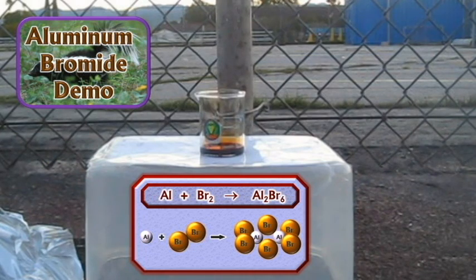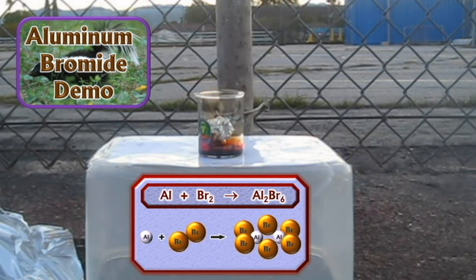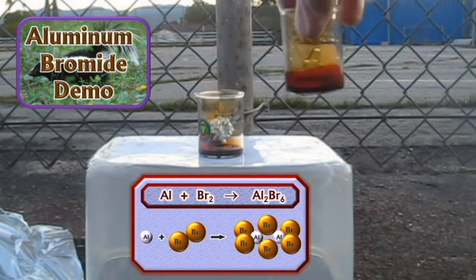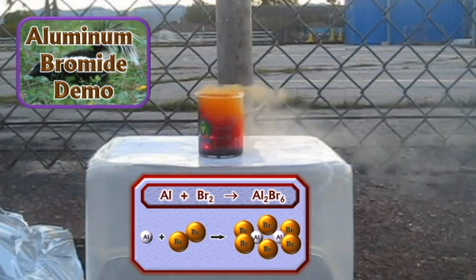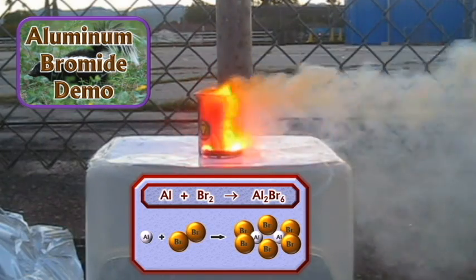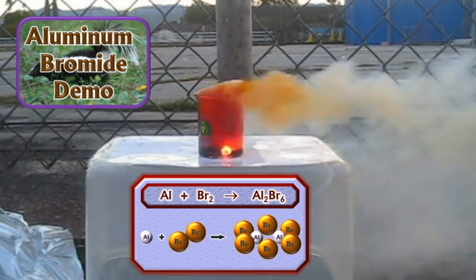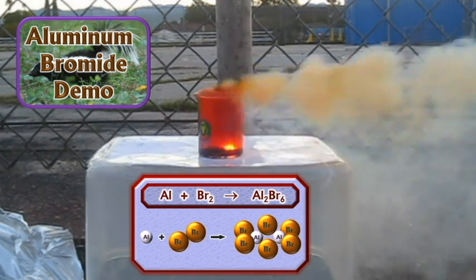Okay, aluminum bromide demo. Little piece of aluminum into the bromine. Contact. The bromine is a liquid. Bromine is one of the only liquids on the periodic table, other than mercury. We're getting a reaction now. Look at that. It's reacting, producing a product, aluminum bromide. The challenge for this lab is to figure out the molar mass of this aluminum bromide.